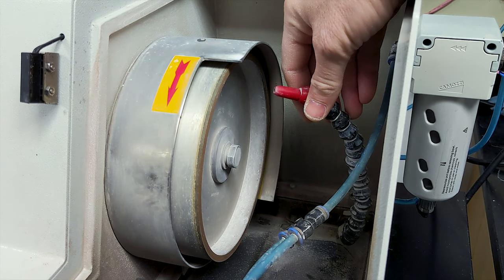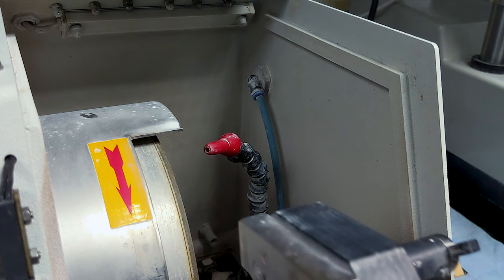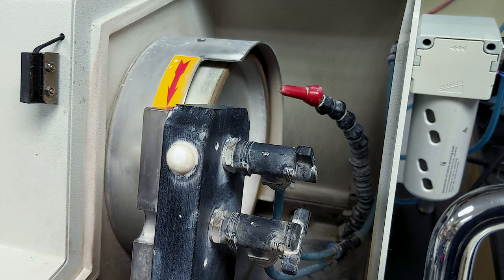Water is pumped and recycled from the water tank and delivered via an adjustable water nozzle to the grinding cup to keep things cool and lubricated.